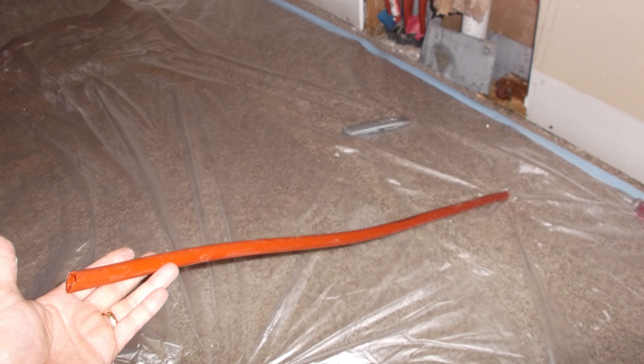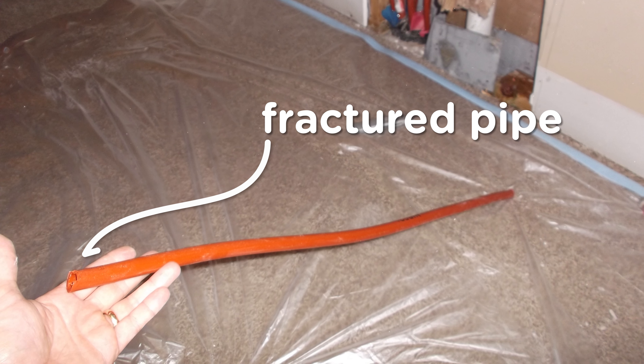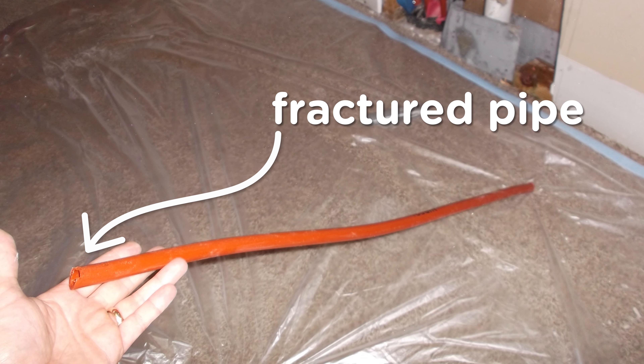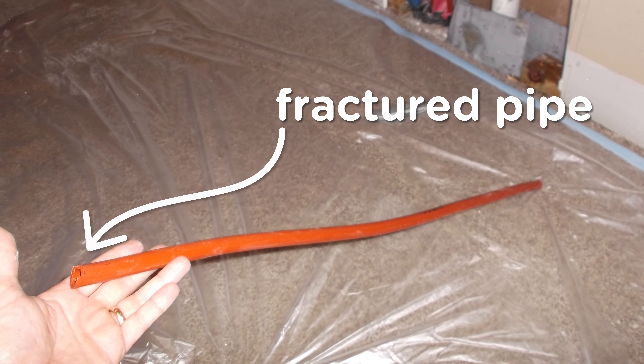What happens when it oxidizes is it becomes embrittled, which leads to premature fractures or breaks, which causes property damage when the leaks occur.